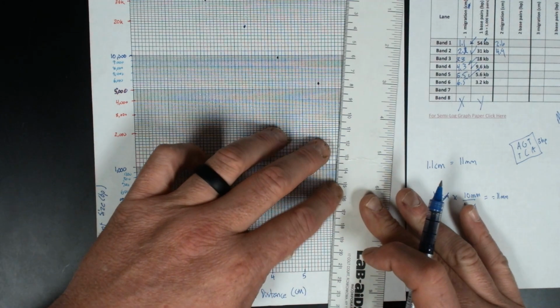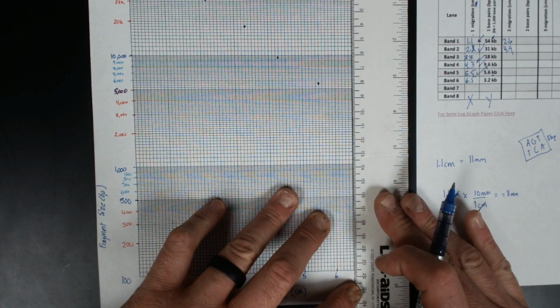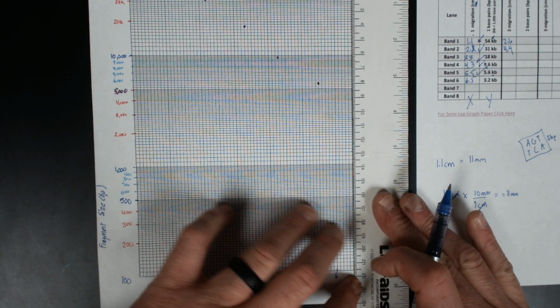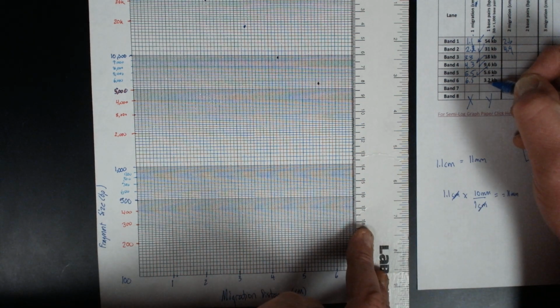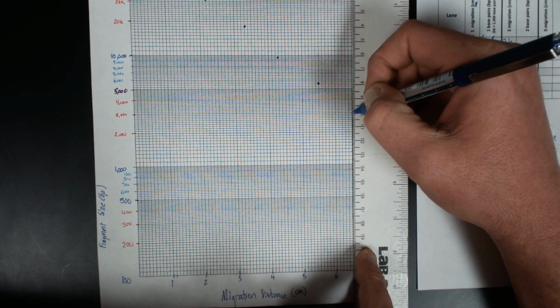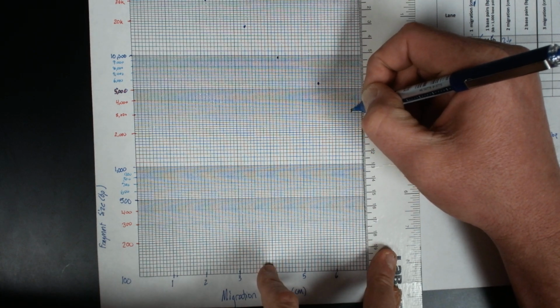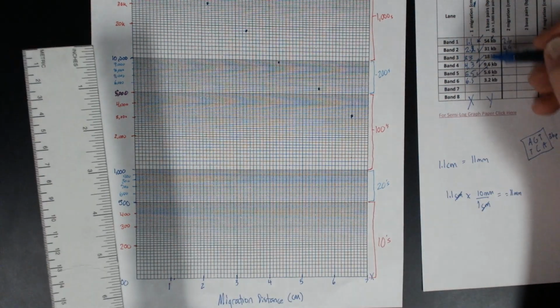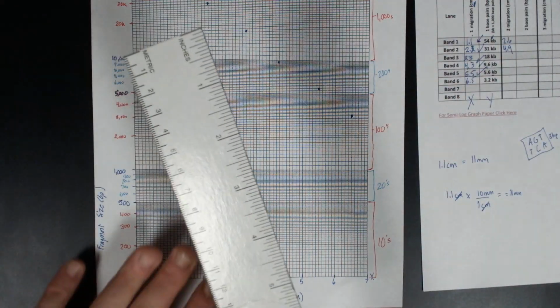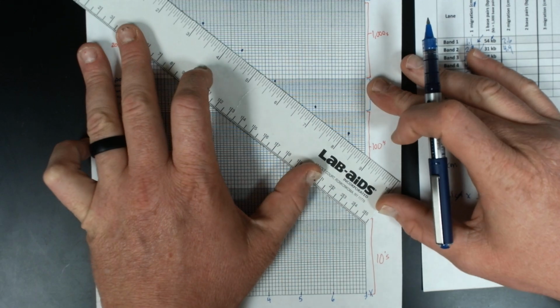6.5 and 3.2. So 3.2 is 3,200, which would be 2 up. Right there. So I've plotted all these points, X and Y coordinates, based on my graph. Now I'm going to make my standard curve. Hopefully these lines line up.